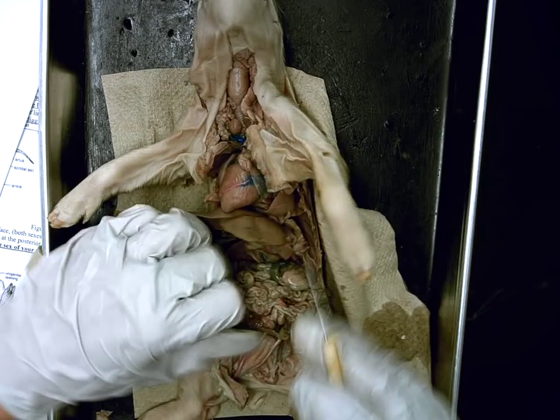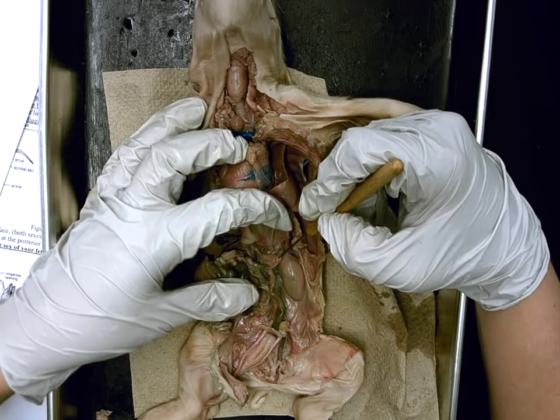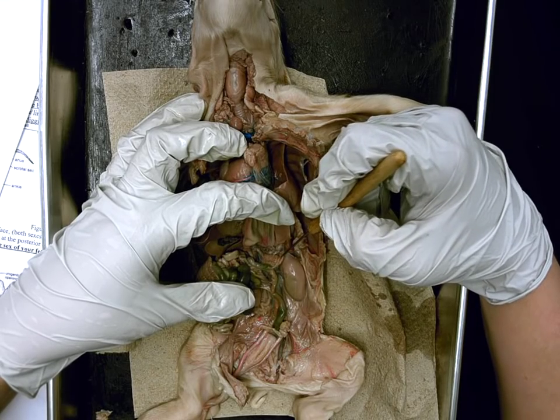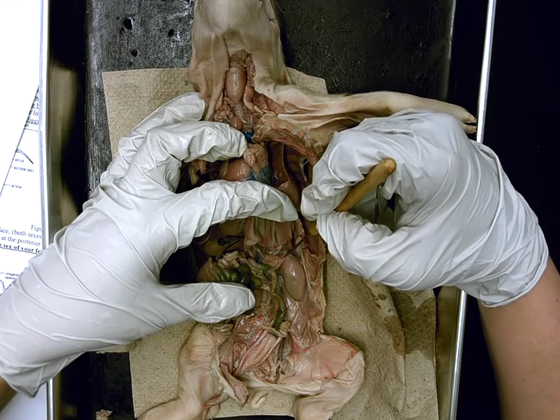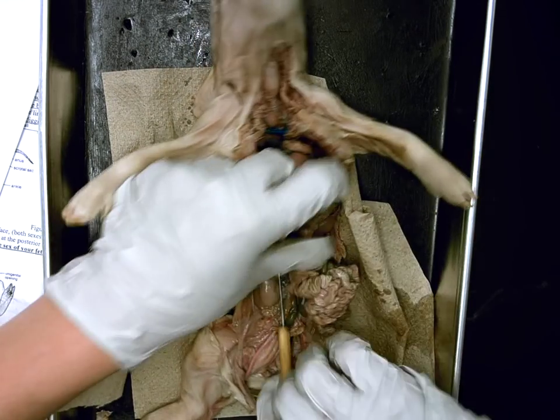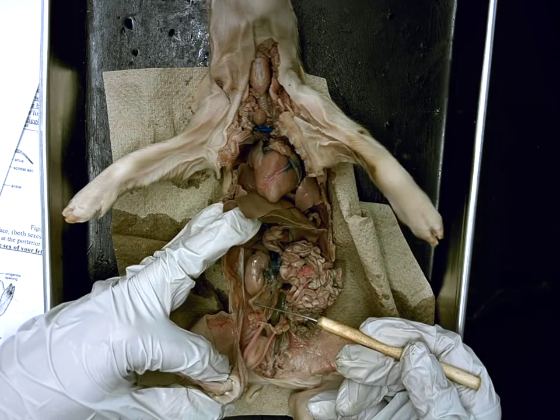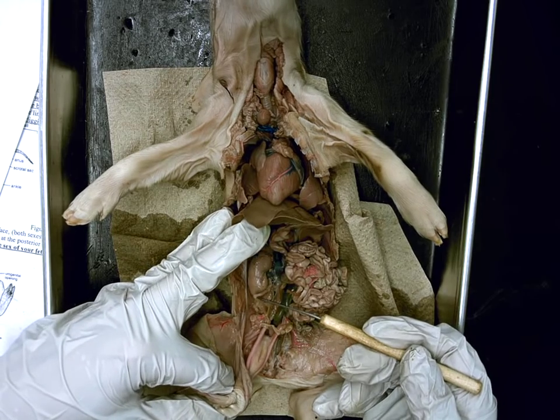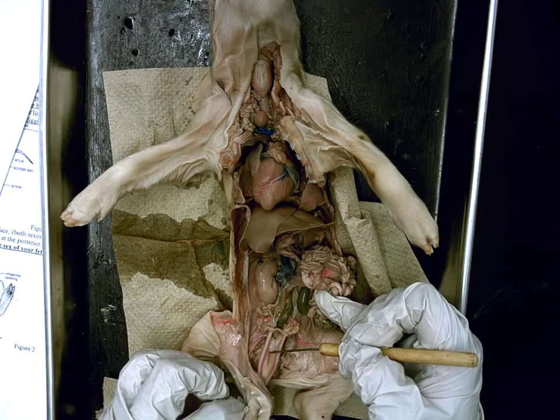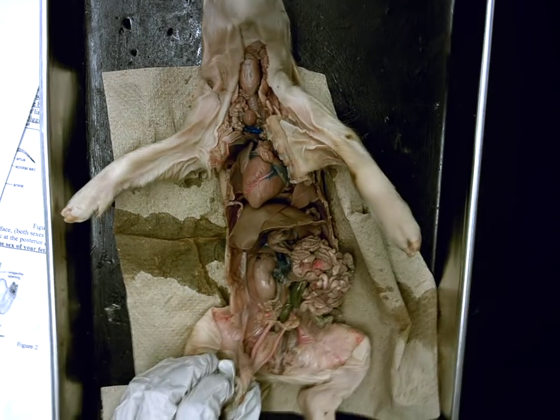If I rotate to this side of the kidney, there's this tiny little structure that sits right on the top inner side of the kidney. Ben? Adrenal gland. Function of the adrenal gland? It releases adrenaline into the bloodstream. Purpose of adrenaline — does it speed the body up or slow it down? Speed it up. If I swing over to this side of the kidney, there's this clear whitish tube that comes from the inside of the kidney. Joe, what would be the name of this tube that drains the kidney? Ureter. So the ureter drains urine from kidney to where? The bladder. Function of the bladder, Shervin? Stores the urine. Correct.